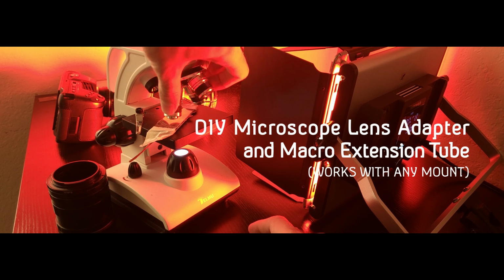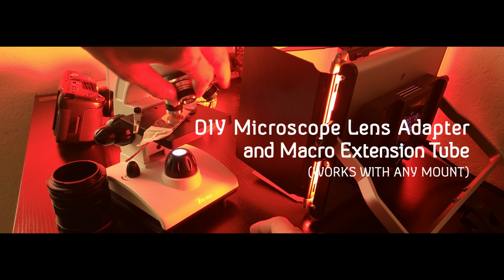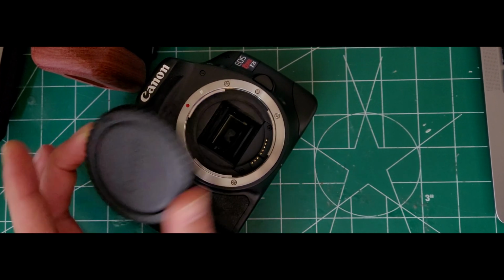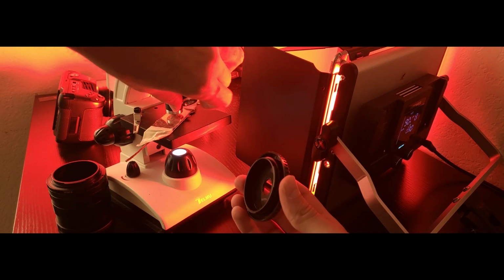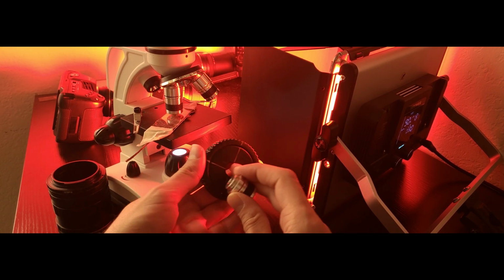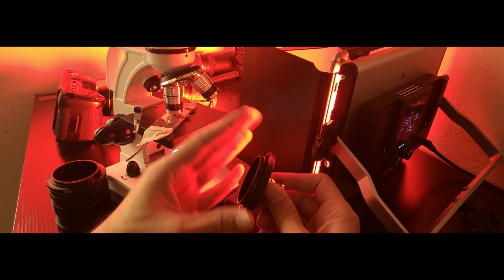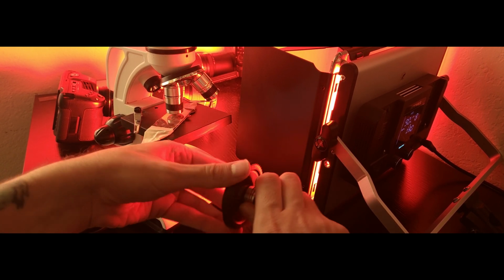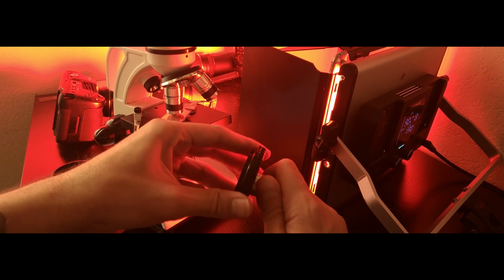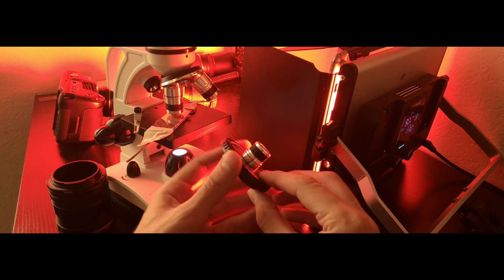There's also a way to DIY this adapter easily. I used one of my old camera body caps for this DIY project, which is also extremely cheap. Basically, I made a hole in my camera body cap with a power drill, and as I measured before, it fits perfectly without leaking any light from the edges. That goes to my Canon EOS M.